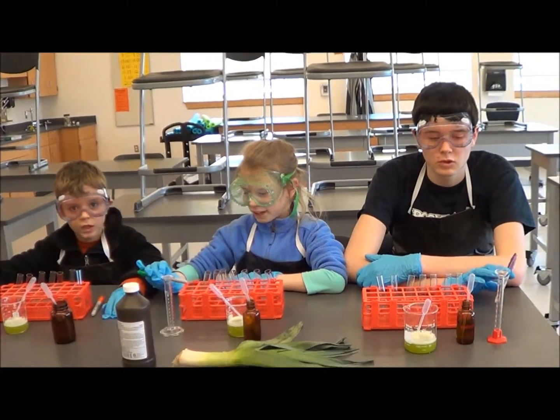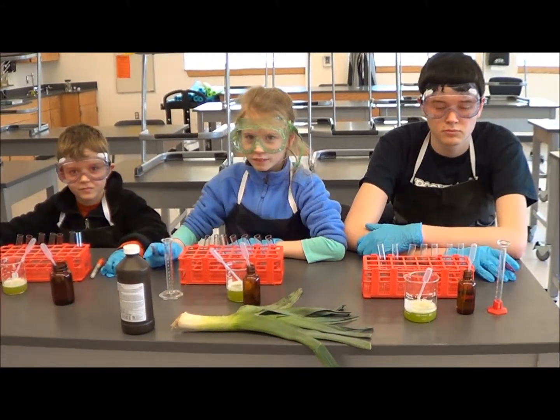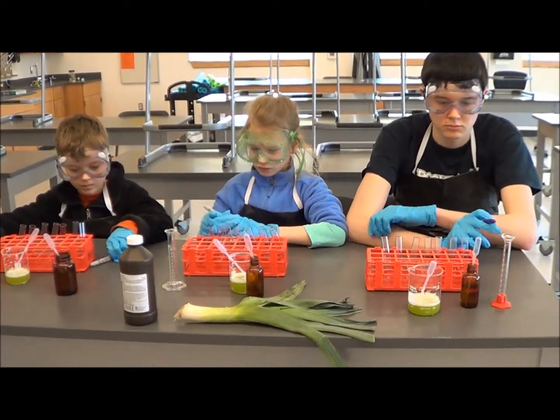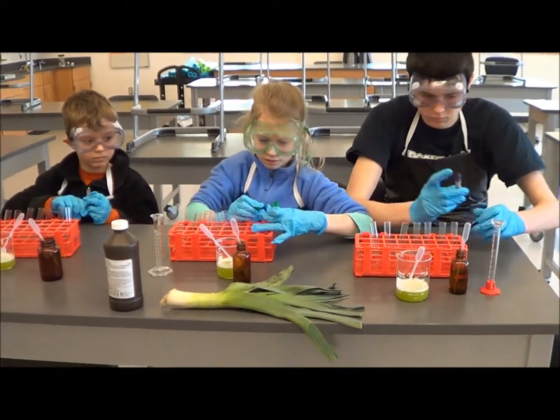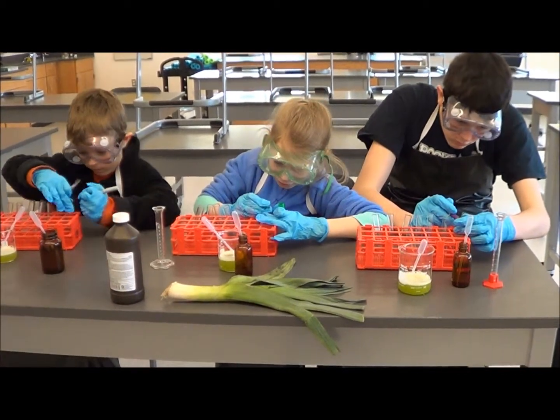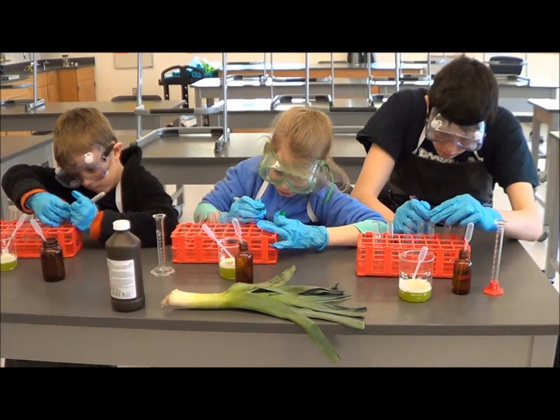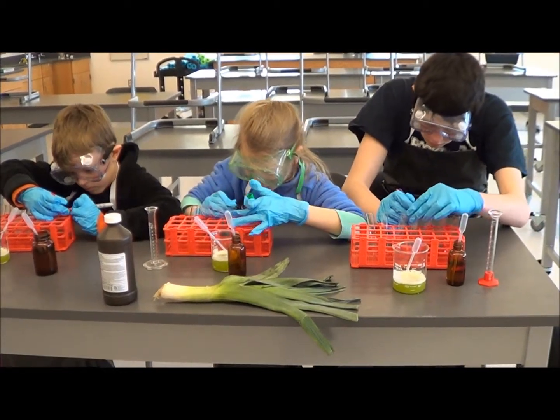Hello science kids! Your first job is going to be to take your pen and label each test tube. The first one label zero, and the next one label one, and then the next one label two, three, four, five, six.